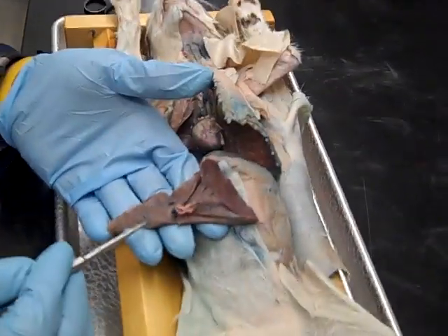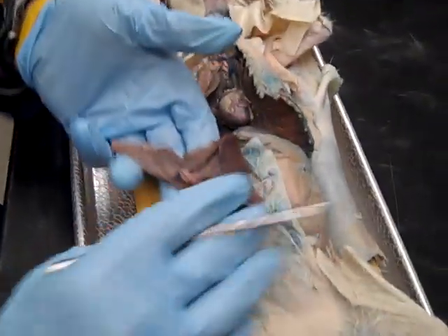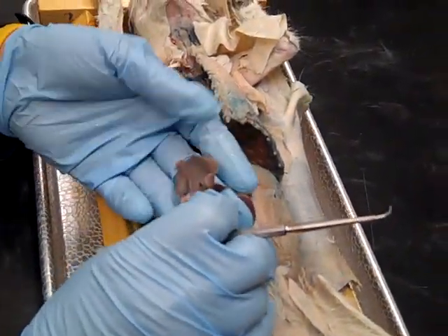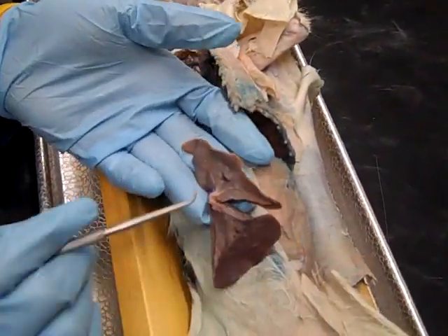We're just going to do the lung. This is the third part of lab three, and this will be a very short take. So here is the left lung, and when it was in this cat, it was arranged like this.